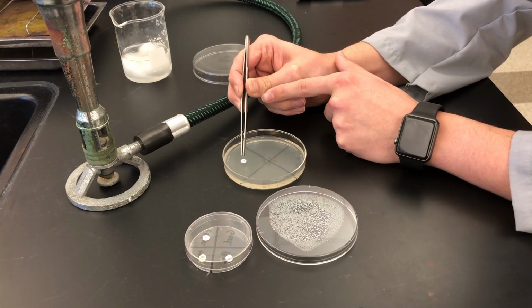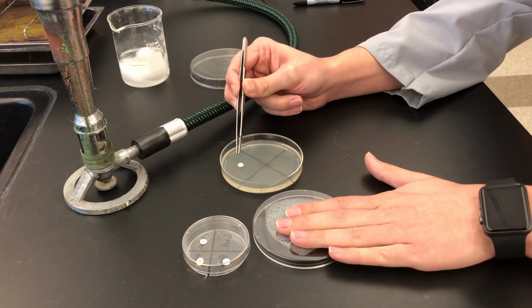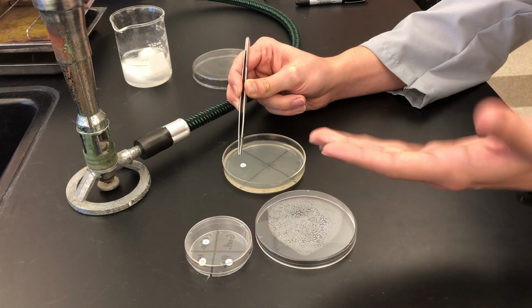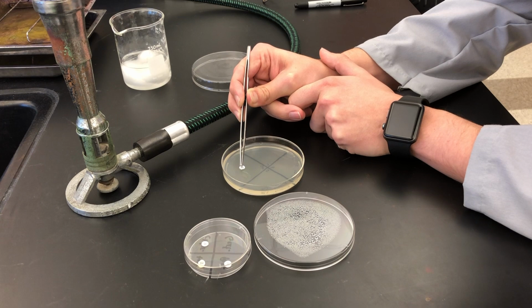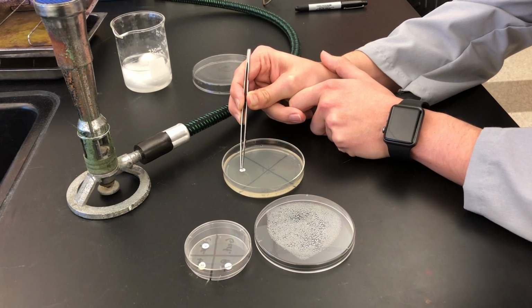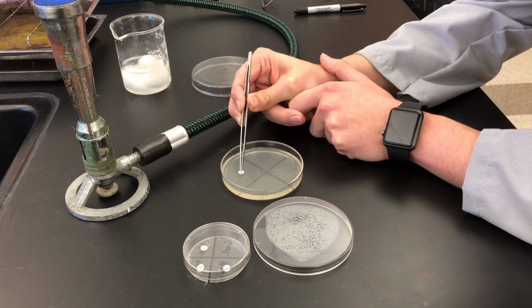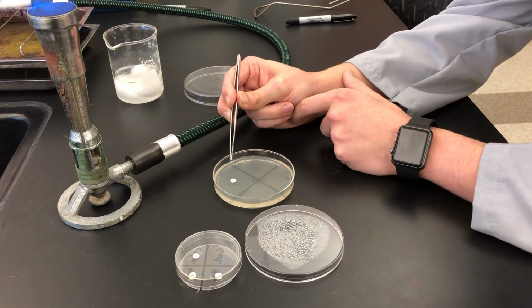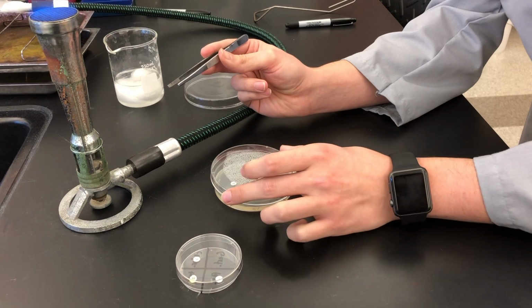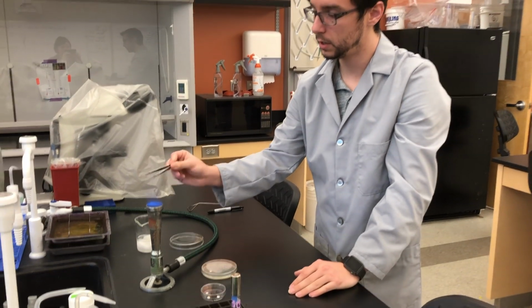Now, the thing is this disc can fall off, especially if we are growing it as we should and turn the plate upside down in the incubator. So to make sure it doesn't fall off, we want to make sure we tap that antibiotic disc into the agar so that it's nice and stuck in place. So tap it a few times, but don't push it in. Small taps are all you need. Go ahead and cover this while you sterilize your forceps.